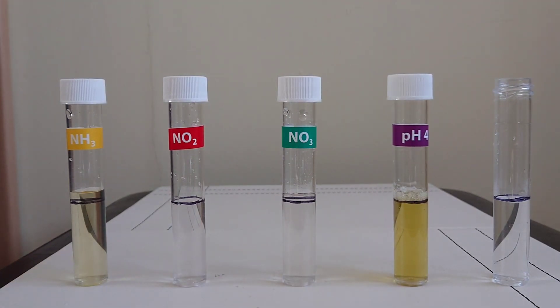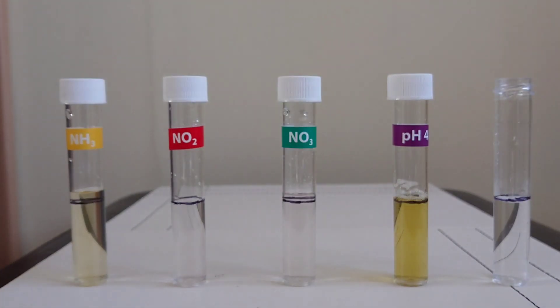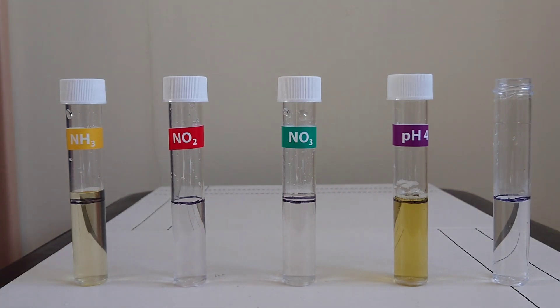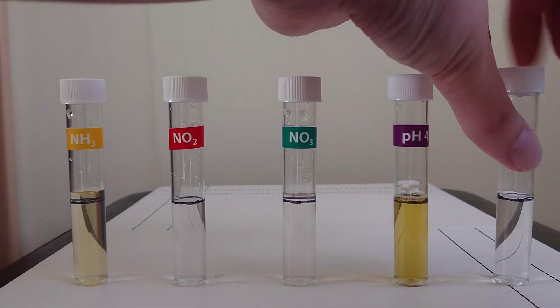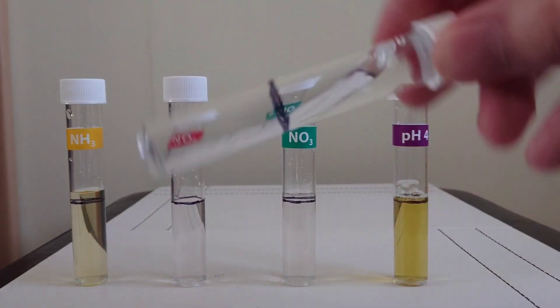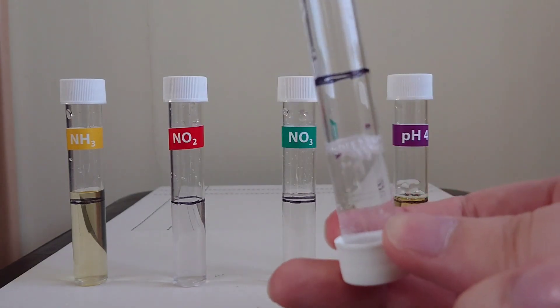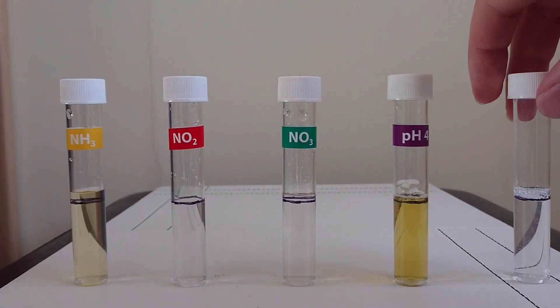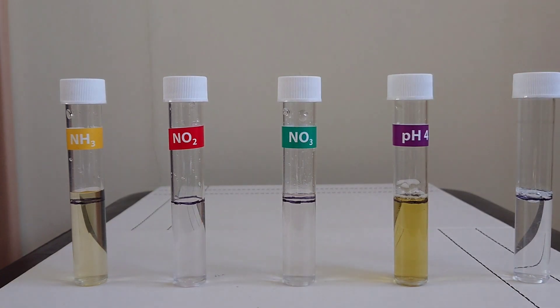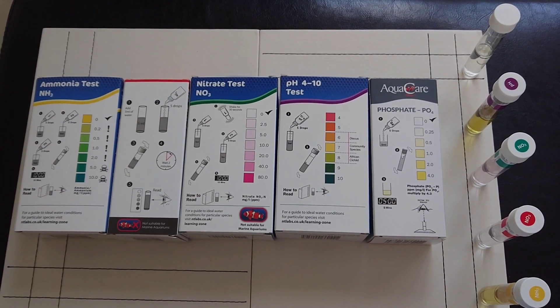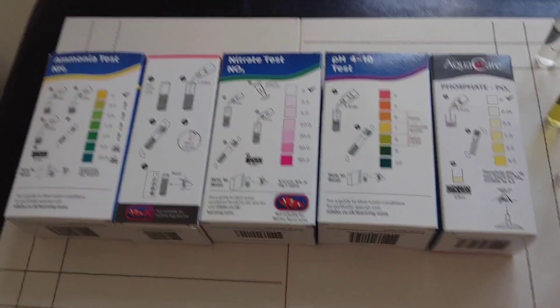And last we have phosphate, which is another one bottle, five drops again, and this one takes five minutes. Okay, so our tests have all developed now, so let's have a look at results.